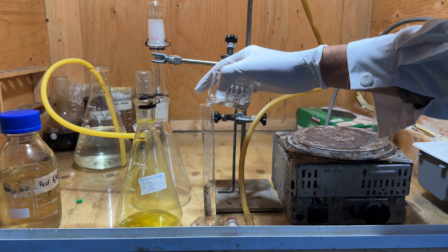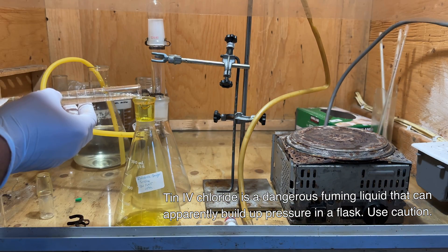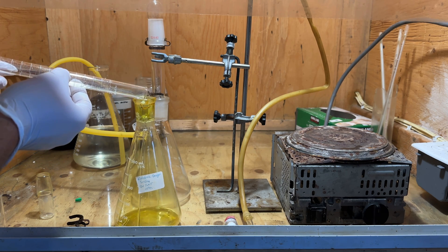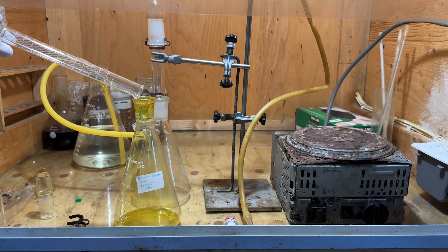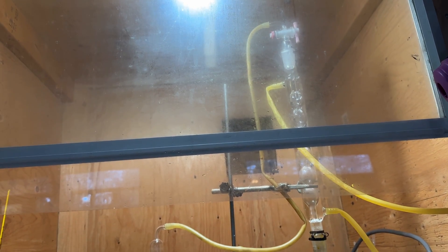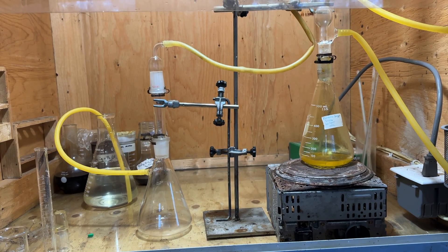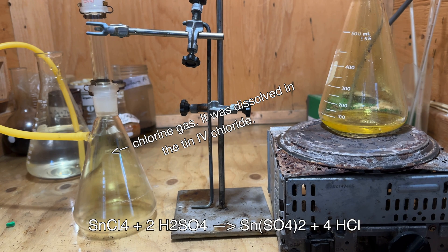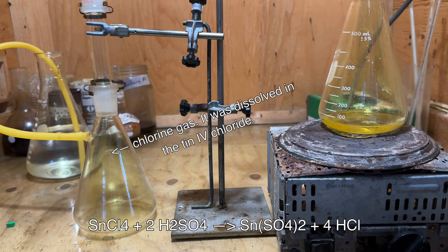To begin, 20 mL of concentrated sulfuric acid was added to 20 mL of tin(IV) chloride produced in a previous video. This represents a slight stoichiometric excess of sulfuric acid to ensure all the tin(IV) chloride reacts. This reaction is very moisture sensitive, so it is necessary to use the 98% concentrated sulfuric acid that we distilled in a previous video. Once the sulfuric acid was added, the mixture was placed on a hot plate and a reflux condenser was added on top with a gas takeoff adapter. Some tubing was used to connect the takeoff adapter to a suck-back trap and then into a beaker of water. The mixture was heated until a steady reflux occurred. As the mixture refluxes, the sulfuric acid reacts with the tin(IV) chloride to produce tin(IV) sulfate and hydrogen chloride gas, which bubbles and dissolves in the beaker of water.